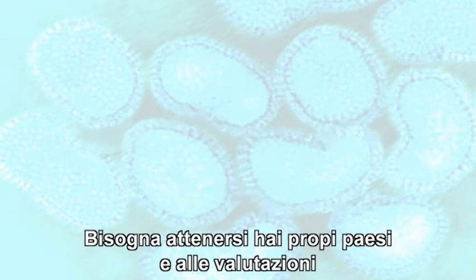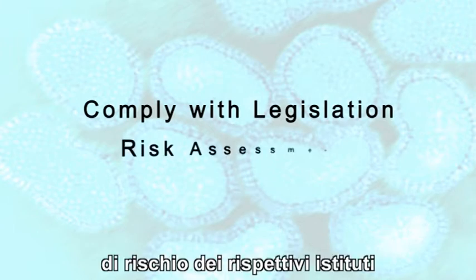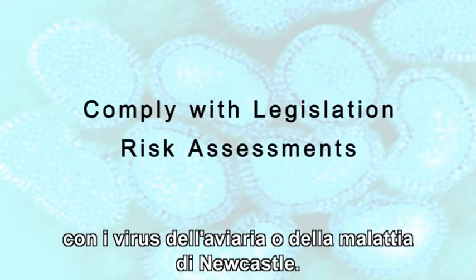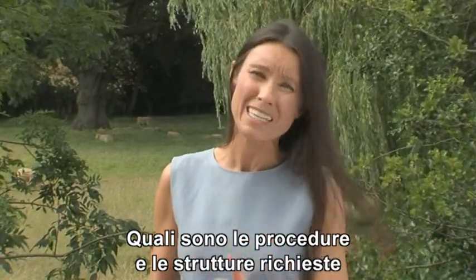Remember, you must comply with your country's legislation and your institute's risk assessments when working with any avian influenza or Newcastle disease viruses. So, what are the procedures, working practices and facilities required when handling materials in each of the risk groups?